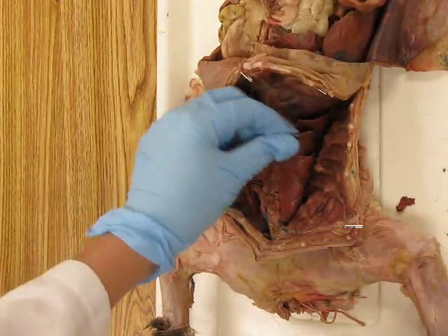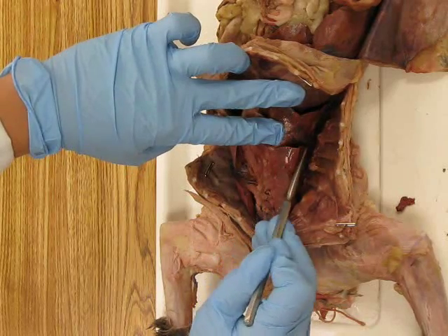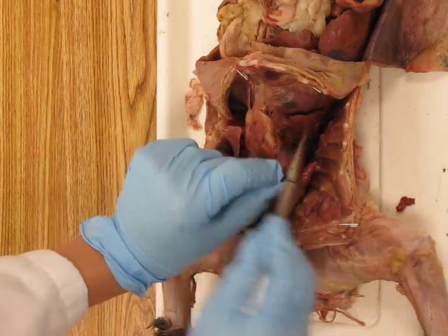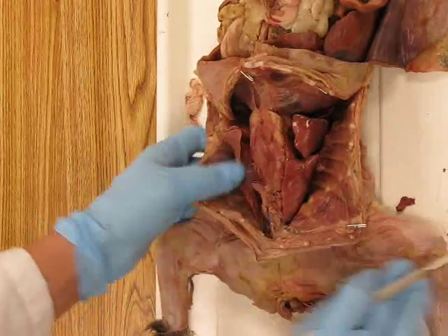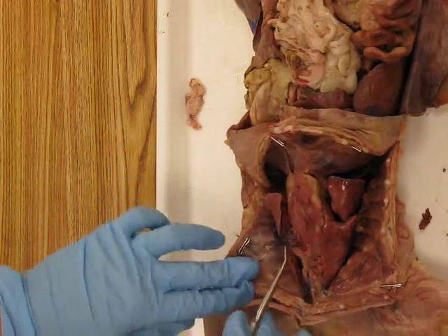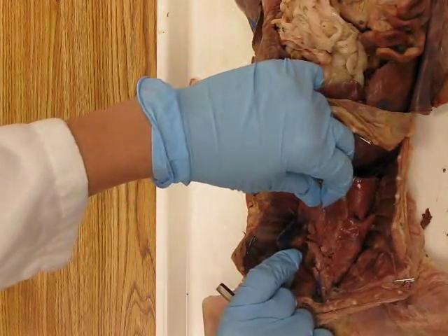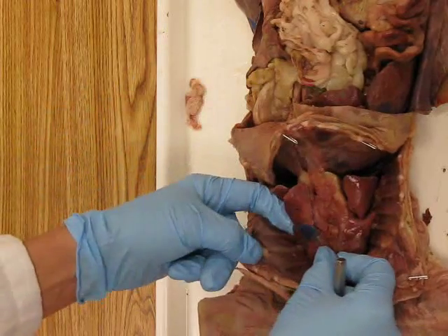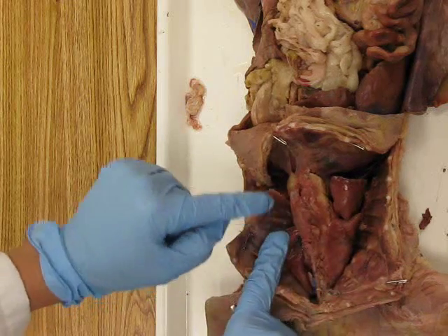The next fissure is called the oblique fissure because it runs at a diagonal along the lung, and that separates the middle lobe from the inferior lobe. Oblique fissure. Now the left lung in the cat has a superior and an inferior lobe as well, but the superior lobe is slightly divided. You can see that there. It's connected at the bottom, so it is all one lobe. So don't let that get confusing. The whole thing is a single lobe. So that is superior and then inferior lobe.